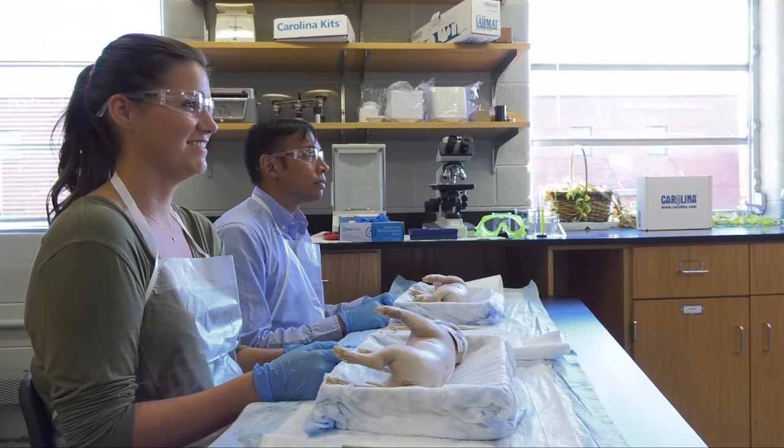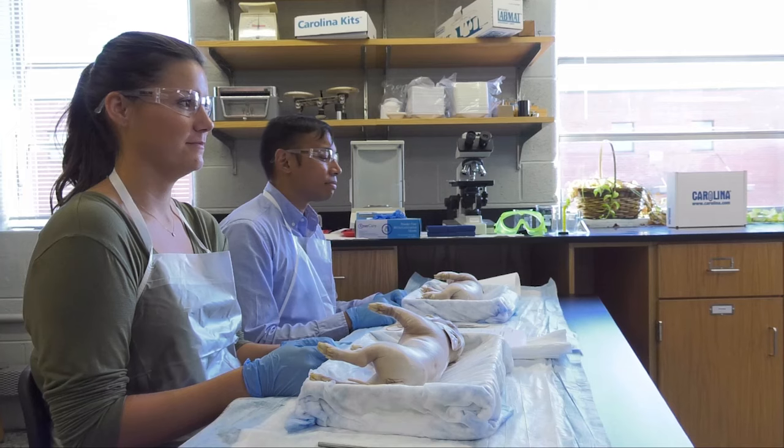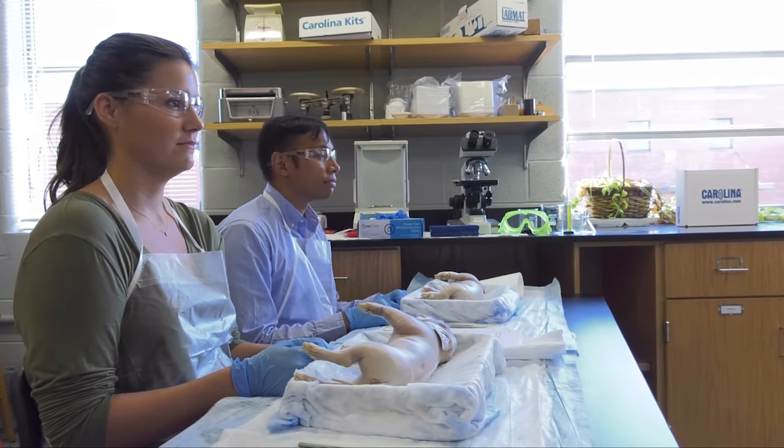Good afternoon and welcome to Carolina's pig dissection. I am Angela White and I will be your facilitator for today's webinar. I'm also a teaching partner with Carolina Biological. I want to introduce two participants who will also engage in dissection with us today: Sarah and Danny. They will be dissecting along with me today.